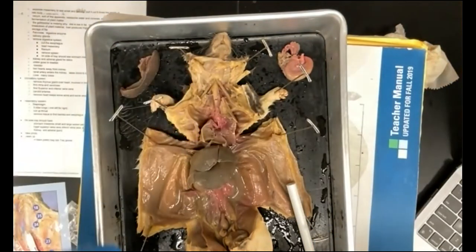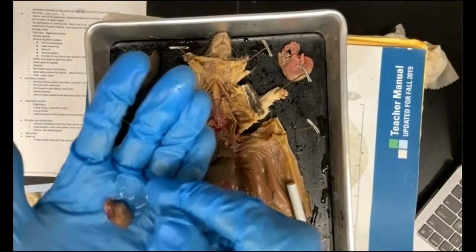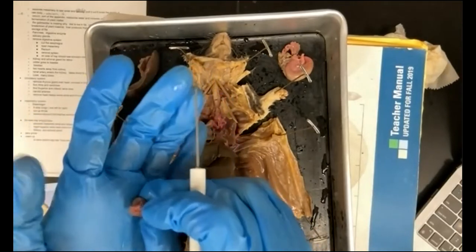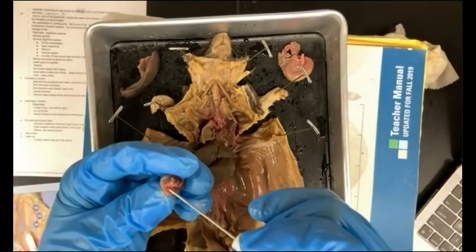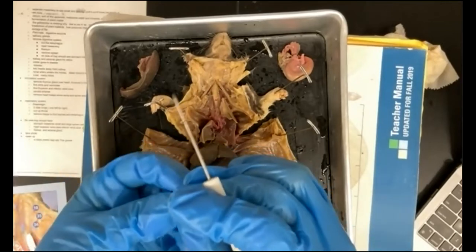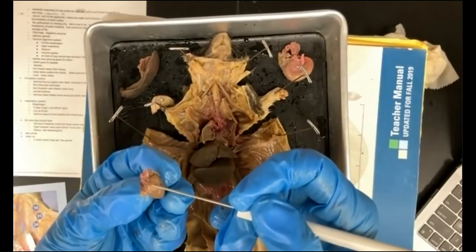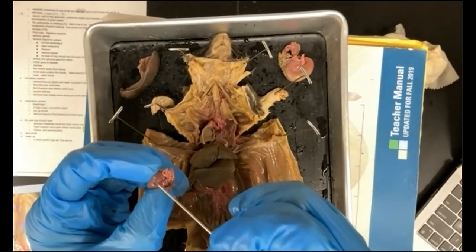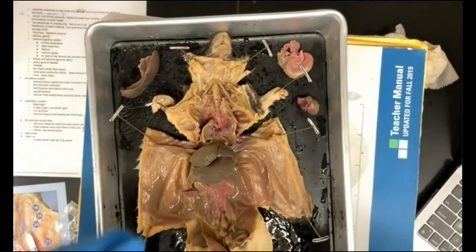All right, and so there's the heart. There's your heart right there. And you can see that there are these vessels at the top. Okay, so there's your aorta right there. And you can see also the superior vena cava. And here is an atrium right there. That would be the left atrium, and the right atrium is right there. Okay, so the heart you can also take out and just place that over there.